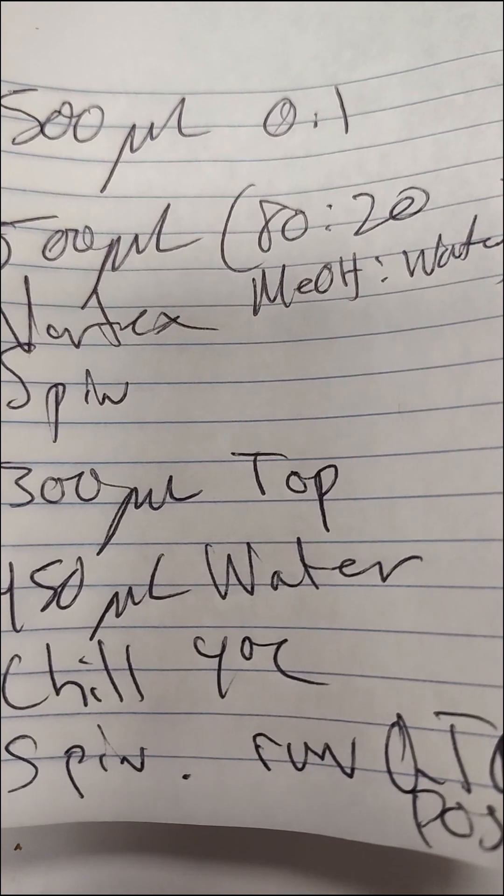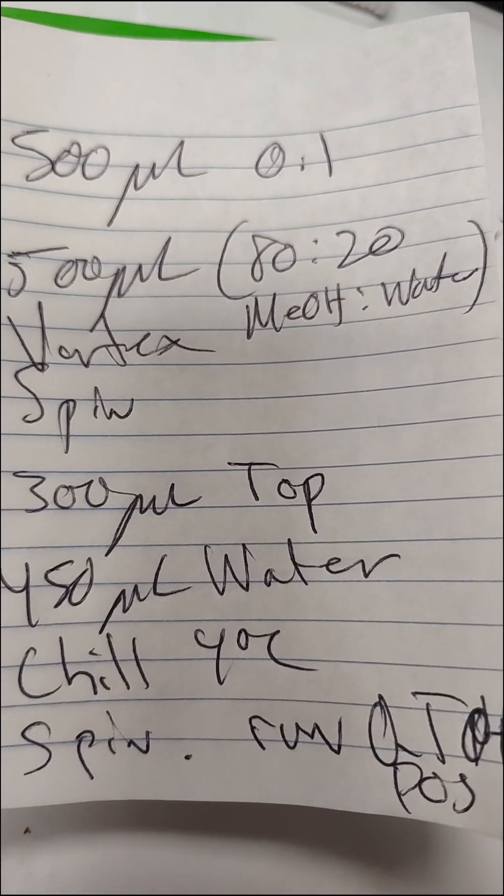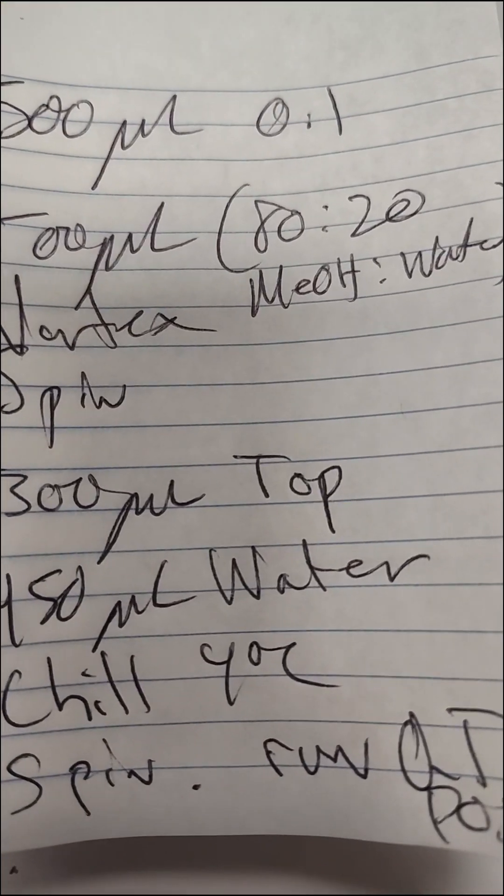That's just regular formic acid to acetonitrile gradient, full gradient. The first thing we need to do is get the oil into the tube here.